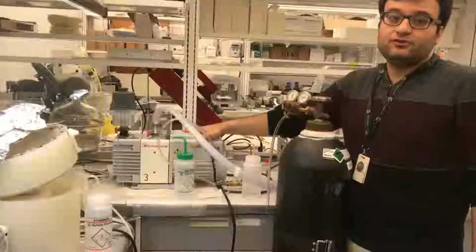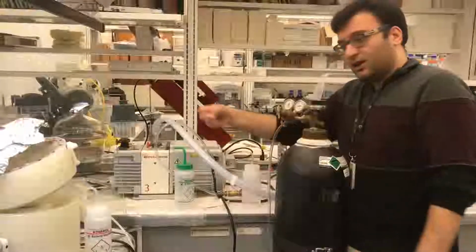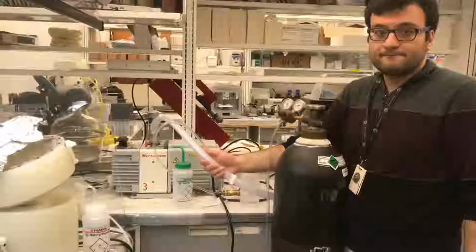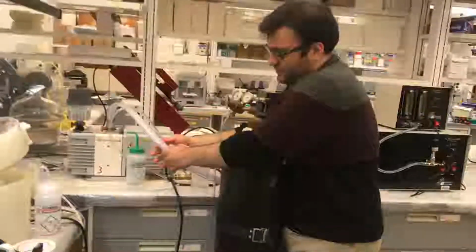If the tube collapses, then we have to buy a new pump, because if it collapses, the air cannot go inside. The pump sucks the air, and that's the reason it creates the vacuum. He told me that Behnaz left it open, and then how did you fix this? No, then I saw that this tube, now you see.